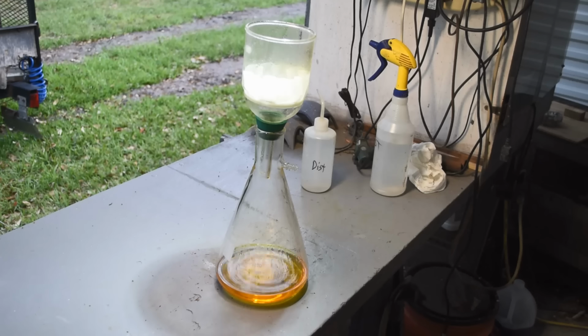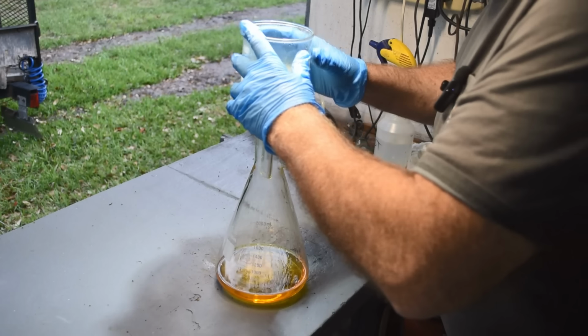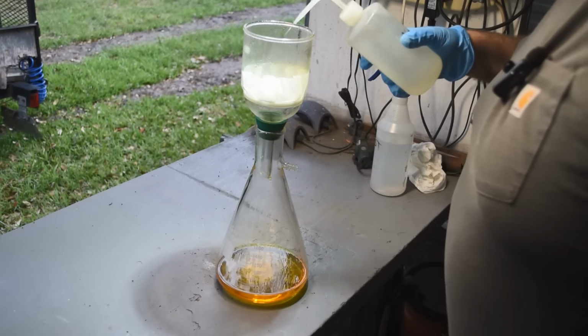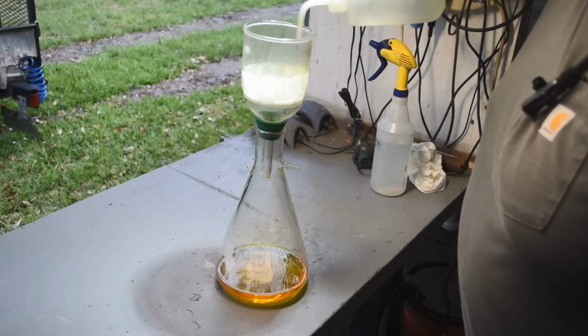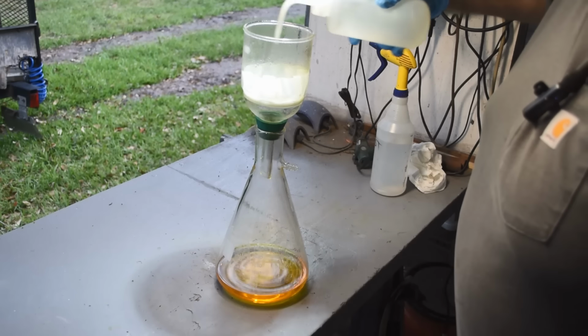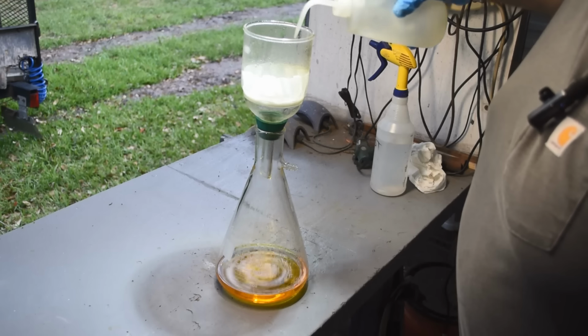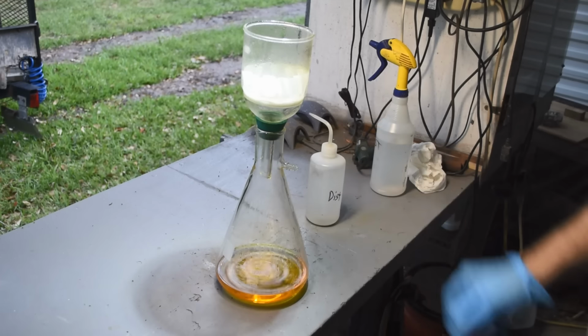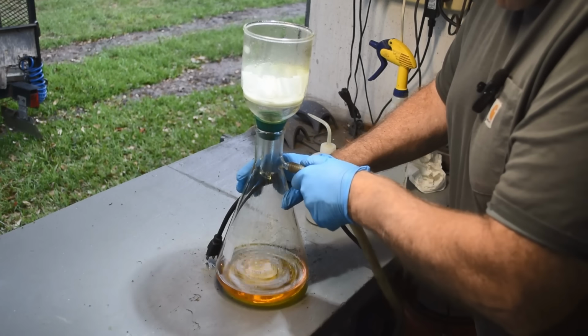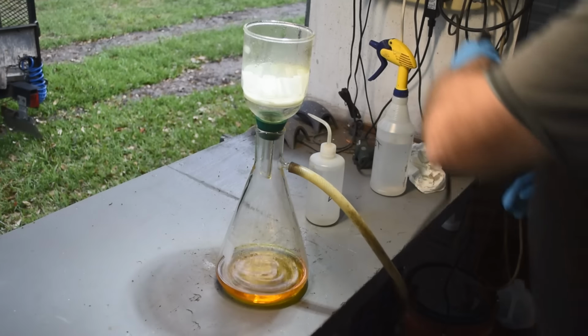All right. All that aqua regia's been through twice. The filter looks amazing. There's no trace of gold in it. In fact, there's not much in it at all except some debris. I'm going to run a bunch of distilled water through here to get the pregnant solution out of the filter and the frit of the funnel. And for that, I will use the vacuum just to speed things up a little bit.